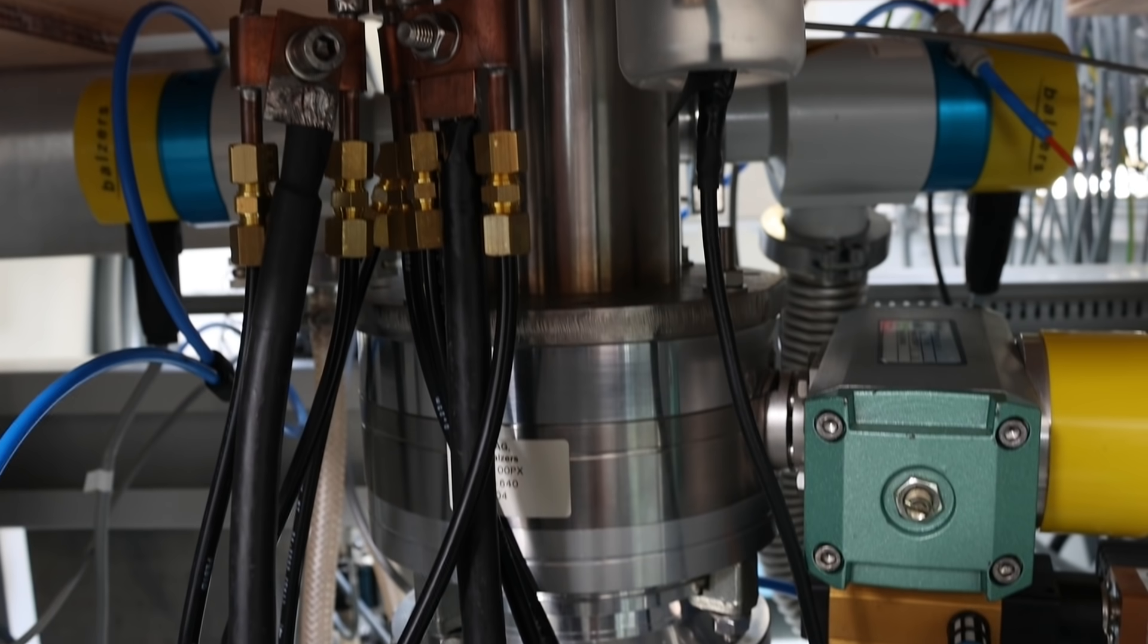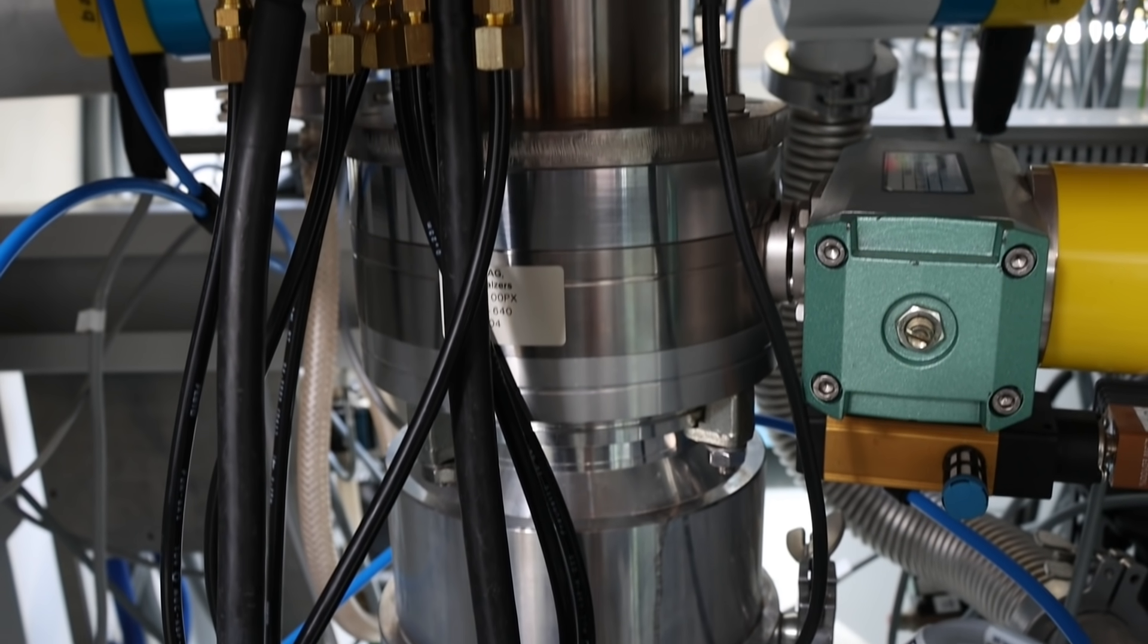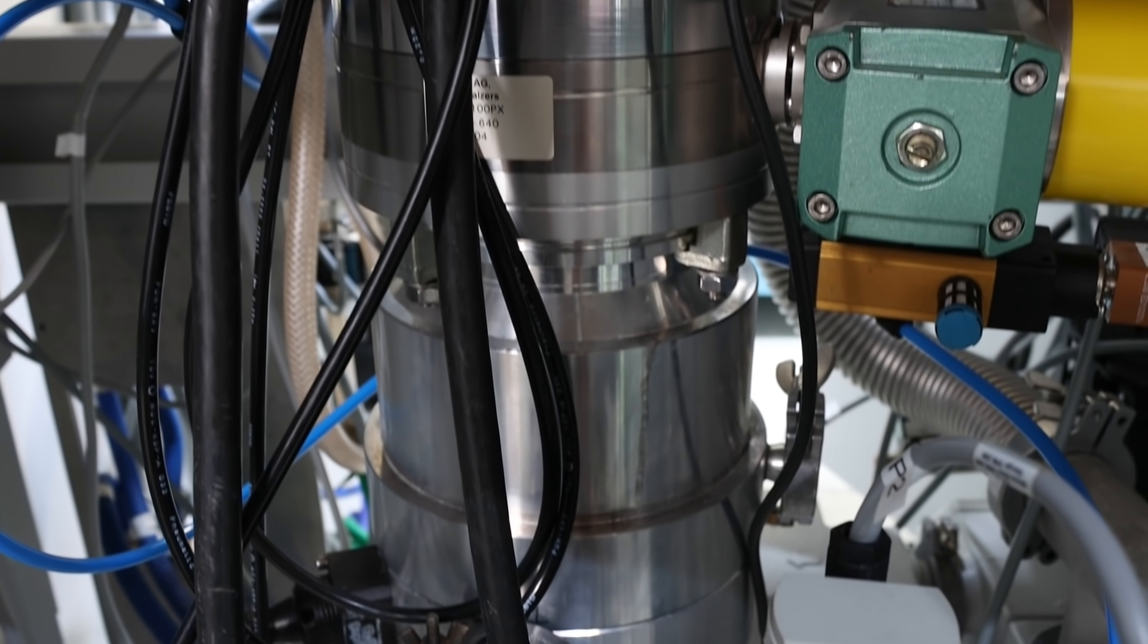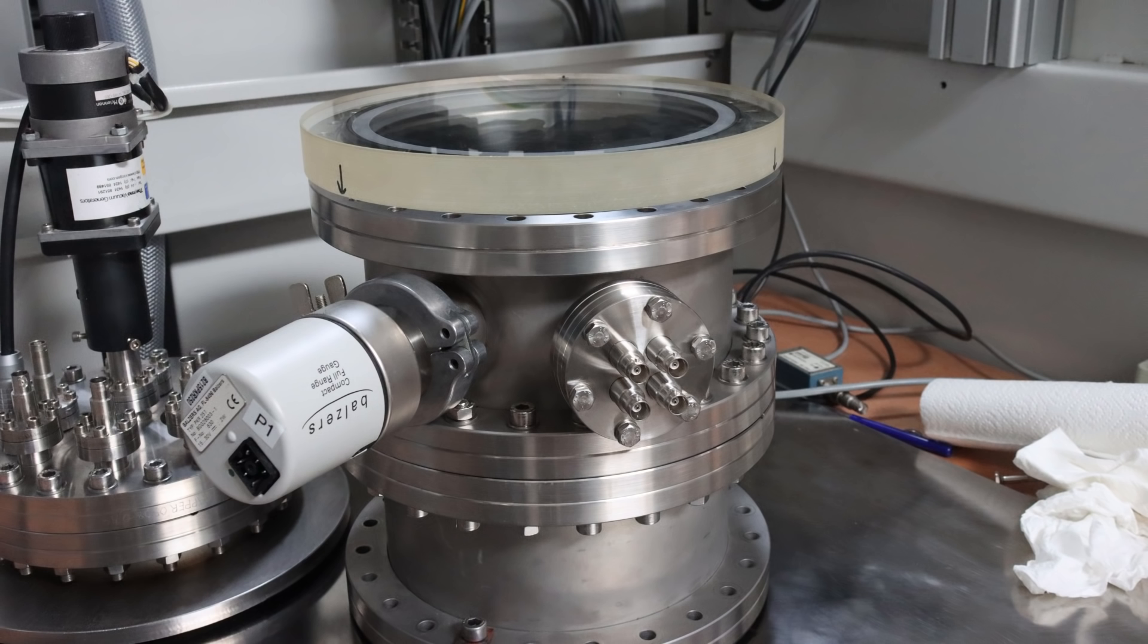The system is now sort of working. Let me just show you what a quick evaporation looks like. In this case, the deposition of a thin layer of silver. In order to get a good view, I temporarily replaced the standard lid with a borosilicate glass disc.